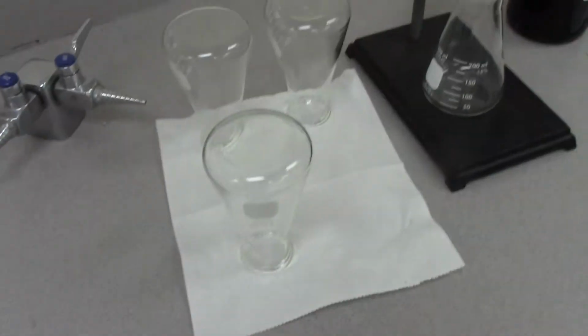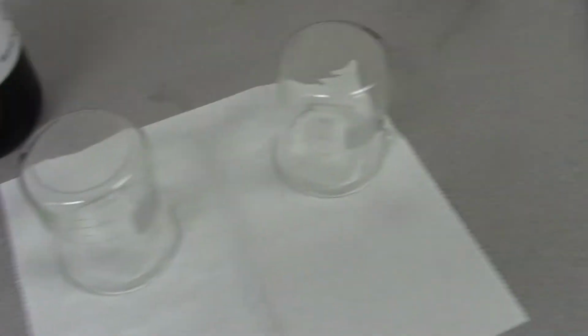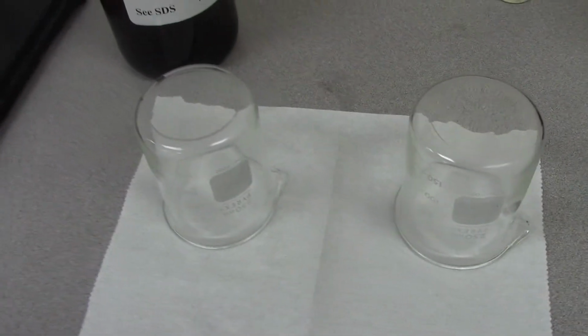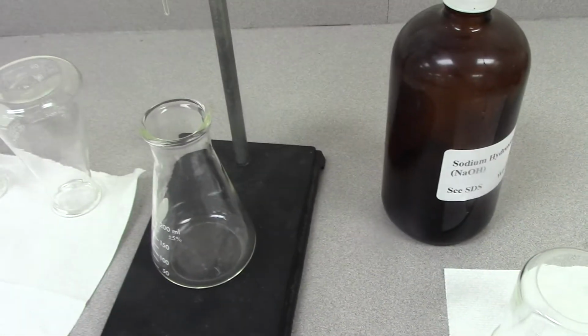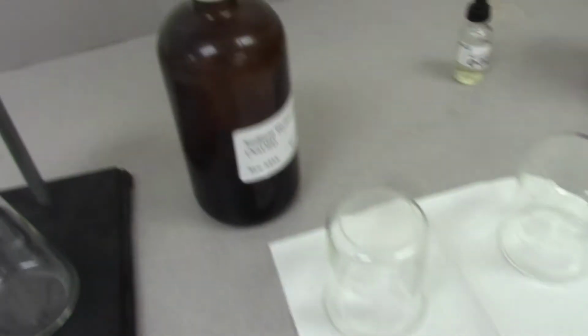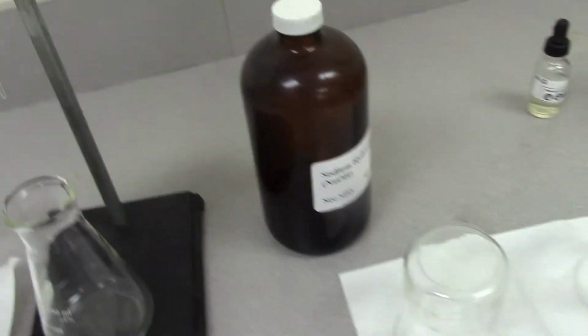Okay, so these are all my materials that I need. All right, I need my flasks, I need my waste beakers. I'm going to have smaller beakers to transfer the volumes of my titrant and my sample, and then I have my indicator, which is phenolphthalein, which will be a couple drops, and then we'll be able to get a pH value, and then we'll do a little math equation to solve for the concentration of the sodium hydroxide, because we don't know that.